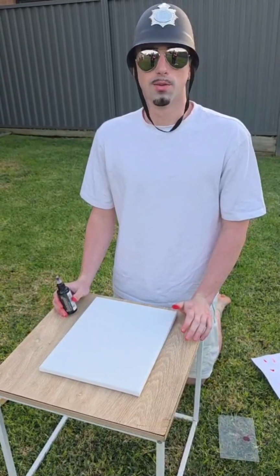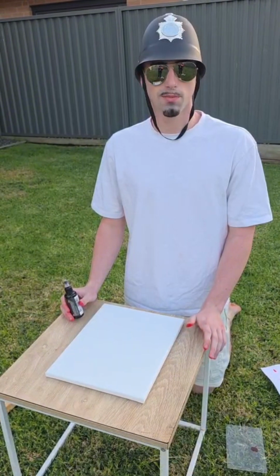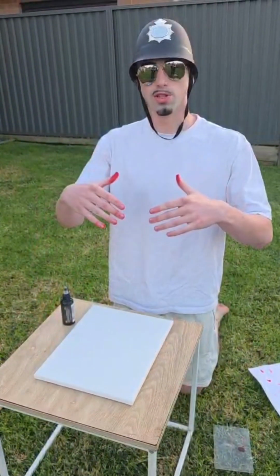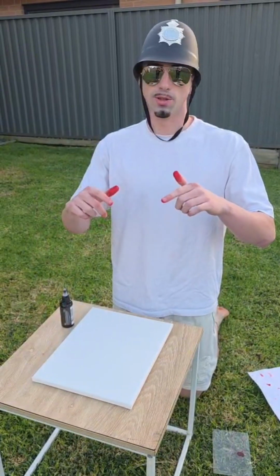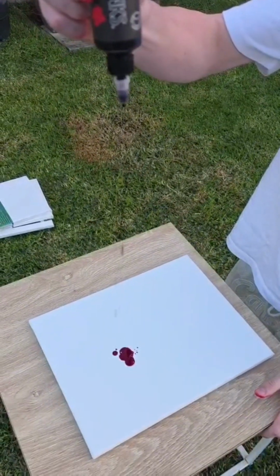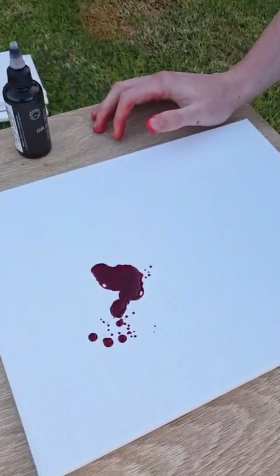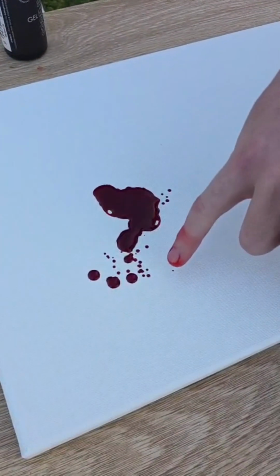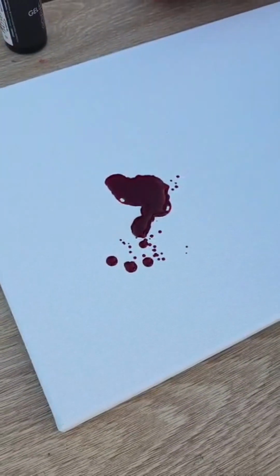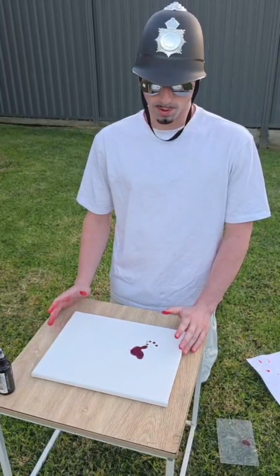Satellite spattering, where in a crime scene this is something we'd look at if someone were to be stabbed, and this happens when blood has dropped onto each other numerous times, creating other little droplets around it. So as you can see here, because the blood was dropped, you have little blood droplets all around, and that's what causes satellite spattering.